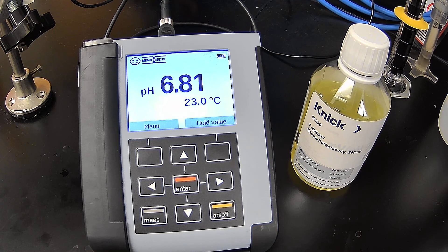So now, anytime you do a calibration on this type of electrode, a pH or ORP electrode, a couple things you want to keep in mind. One, you want to make sure they're clean. Any debris, any kind of mineral deposits, anything that could coat the glass portion or the ORP portion or plugging the junction could and will affect the calibration, the quality of the calibration.